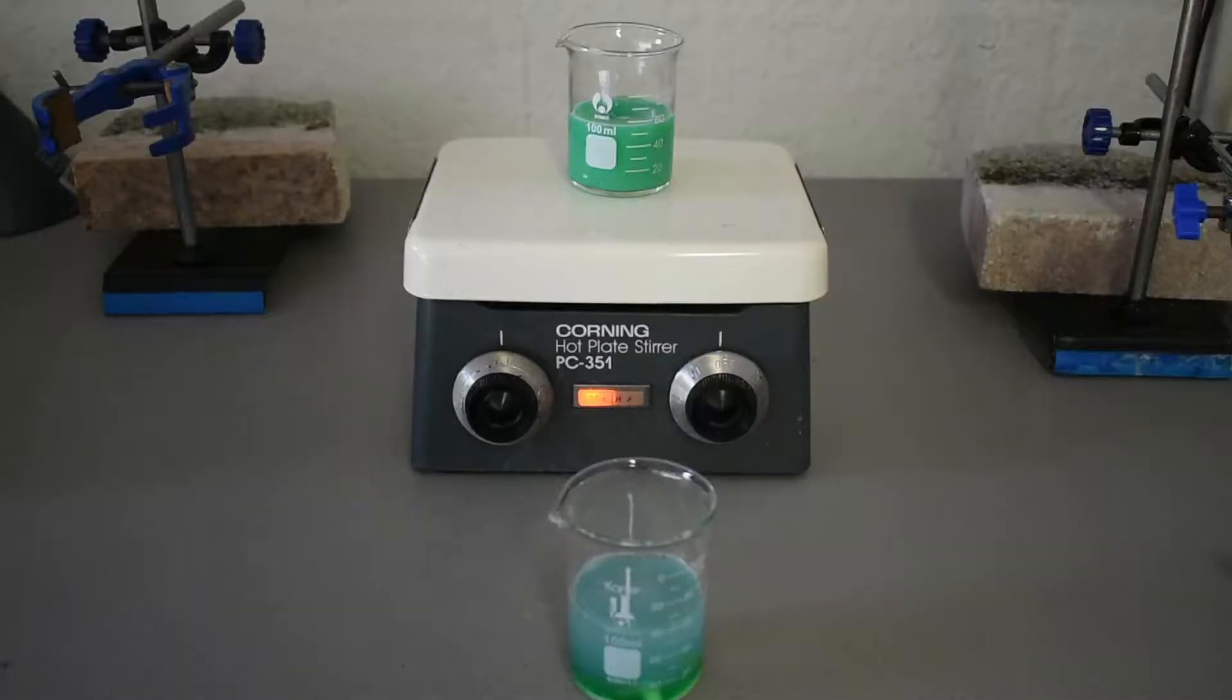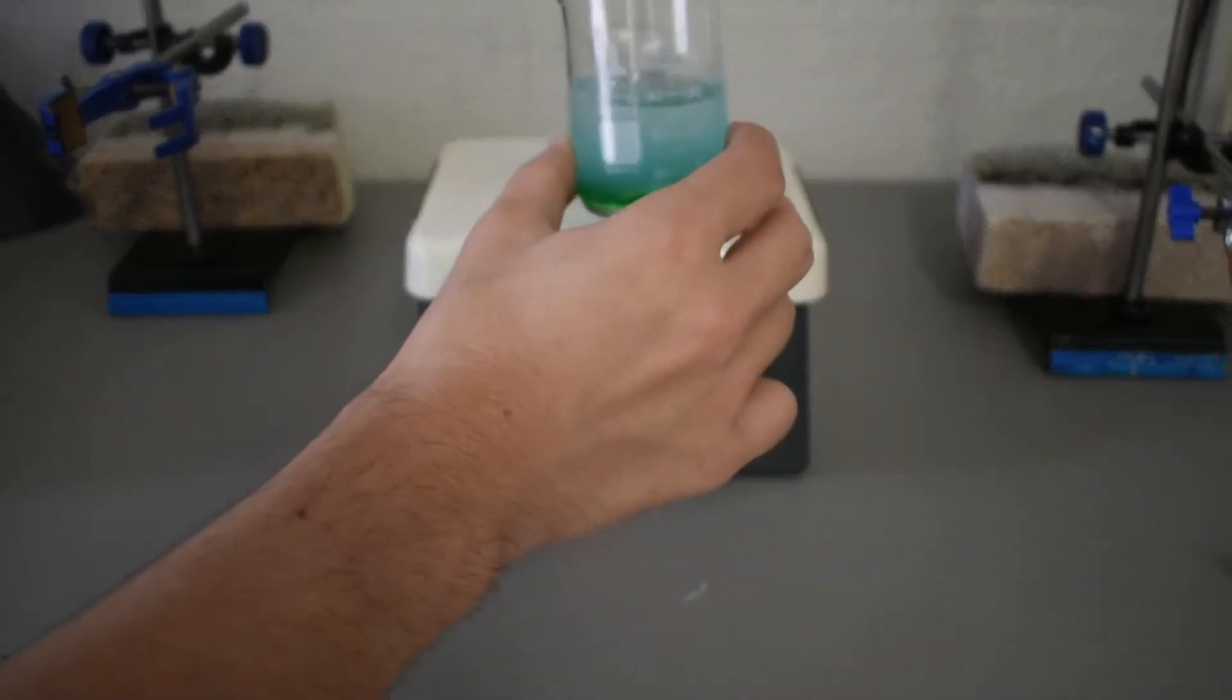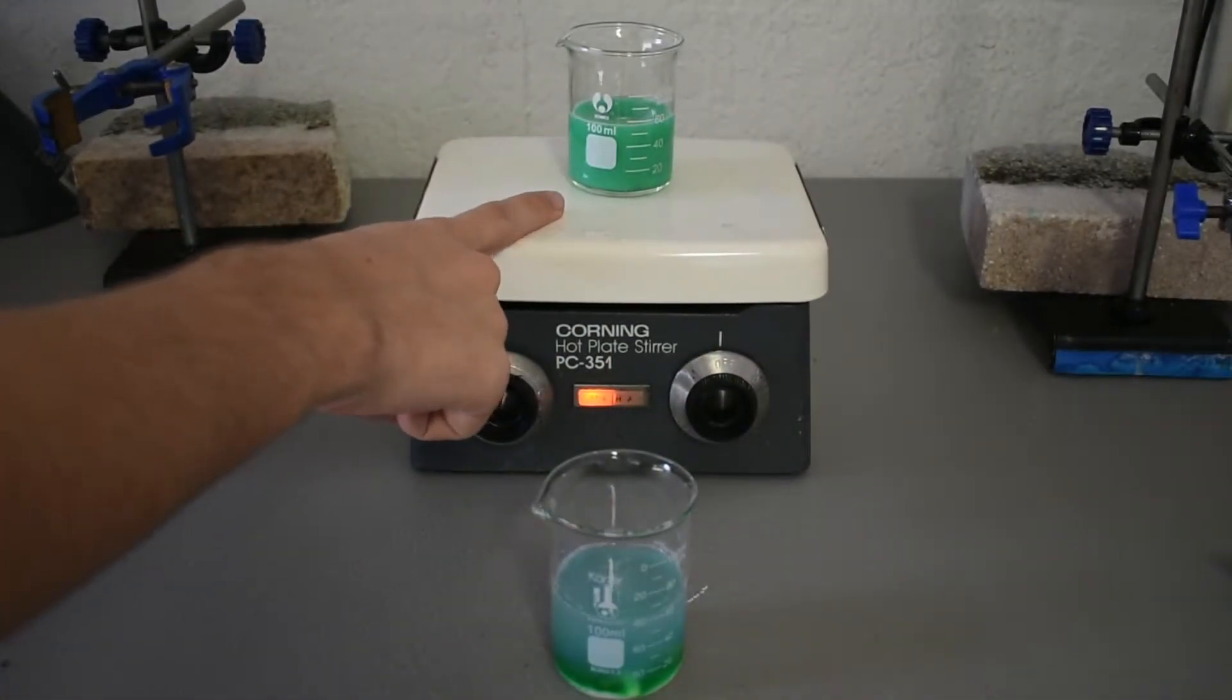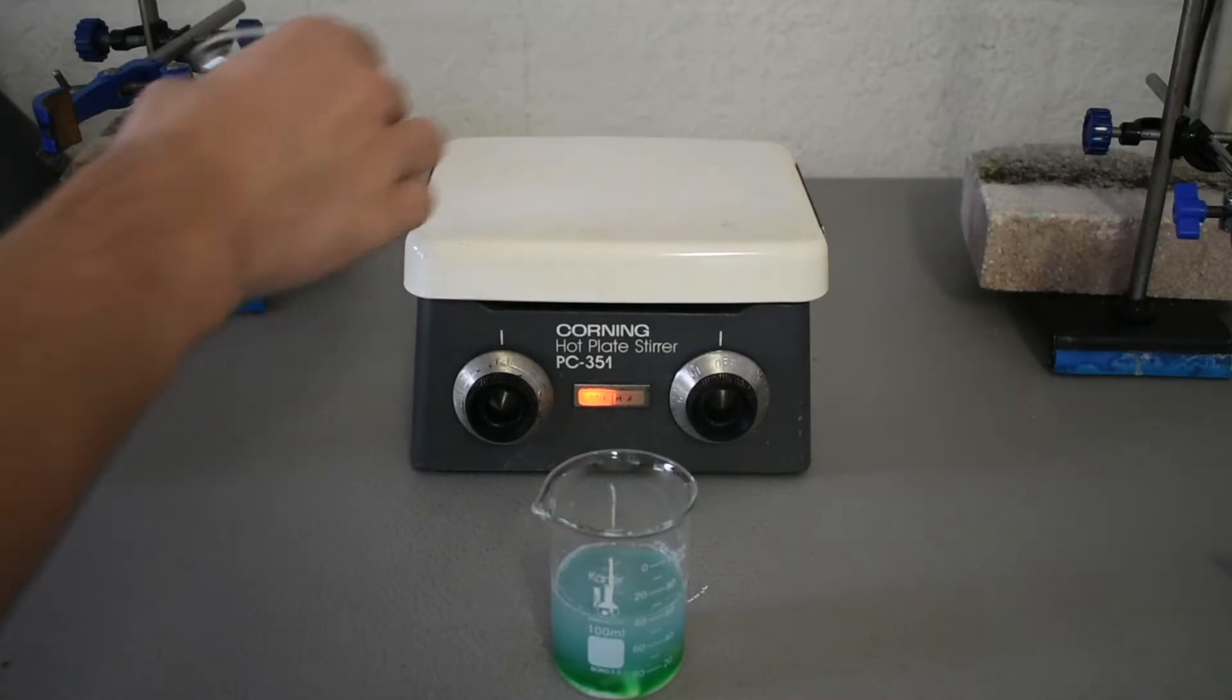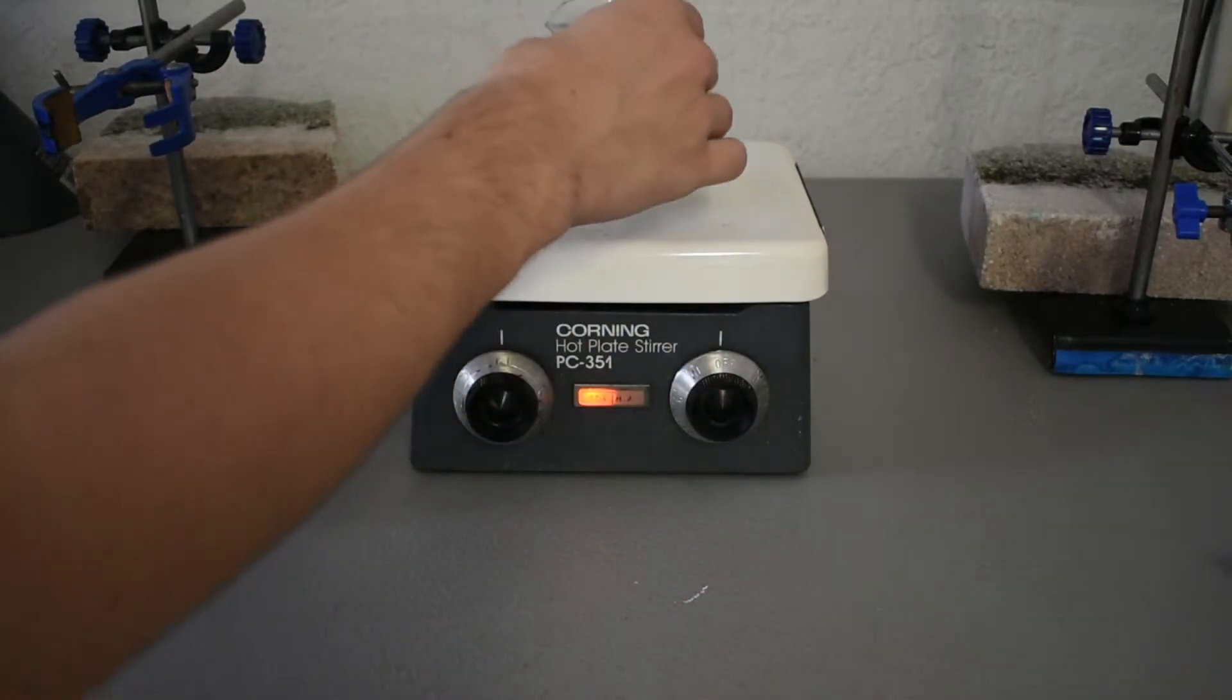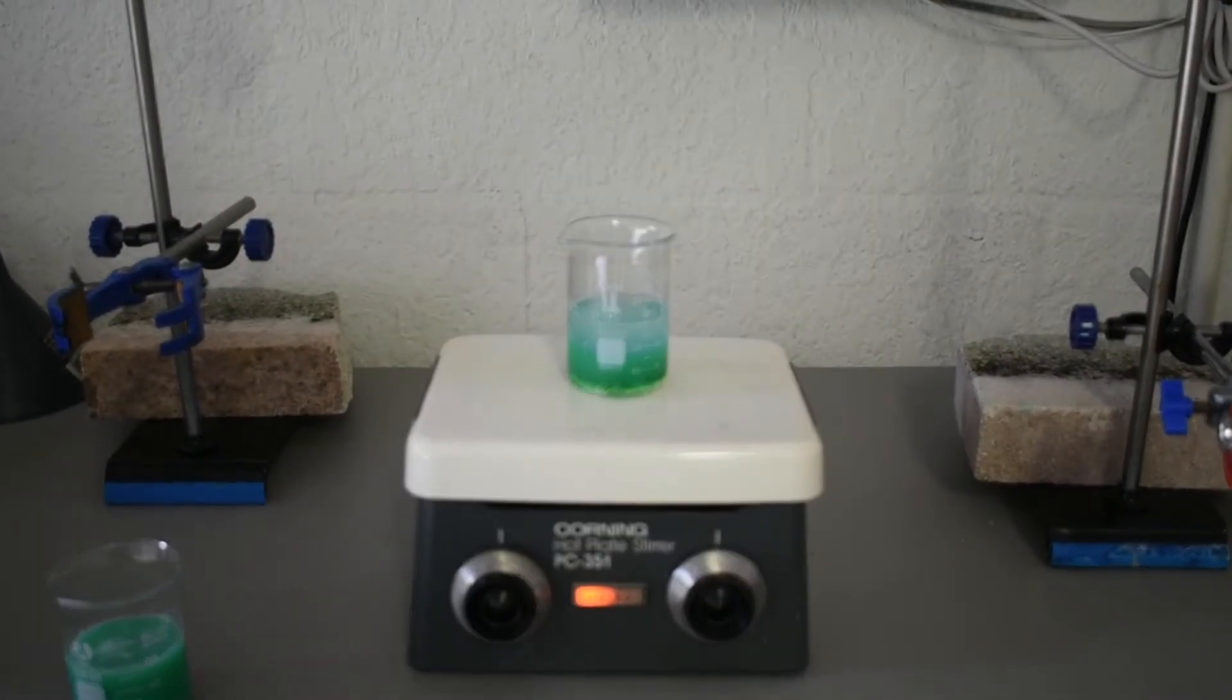Okay, after cleaning up the mess I made, we have our mixture in here. As you can see, the potassium salt has turned pretty green, so I'll take this off and then we'll get this one stirring and we should see it turn more of a cyan.